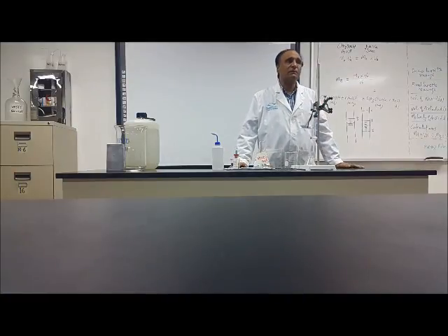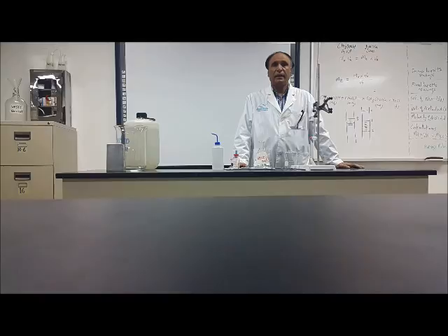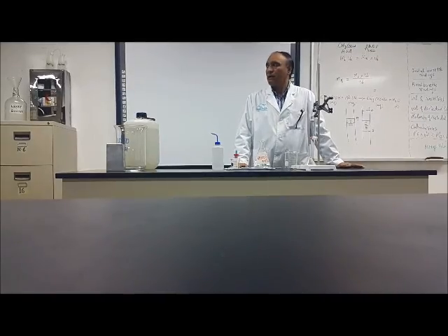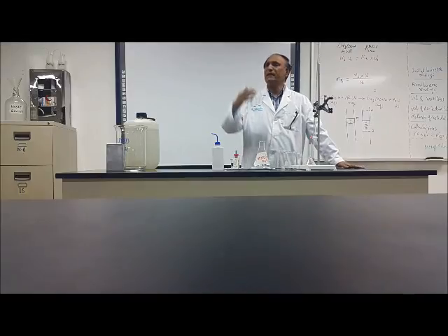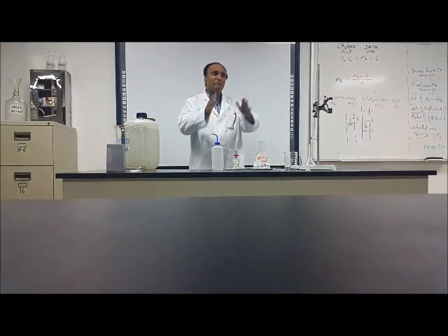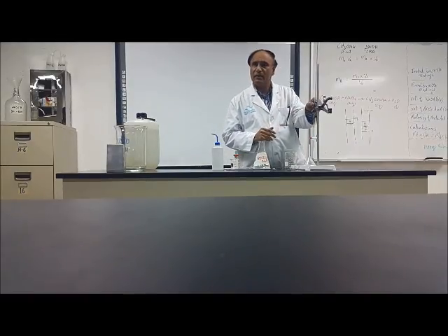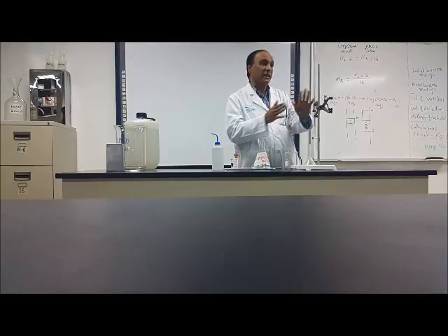This experiment is a very common experiment in chemistry, and if you see the students all over the world, any country, if he is a chemistry student, he must have done this. So it is a very common experiment in chemistry.